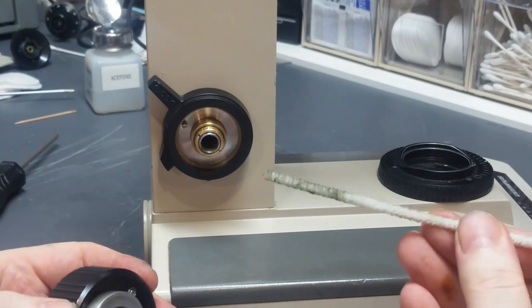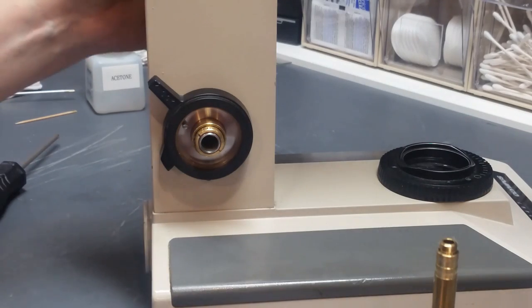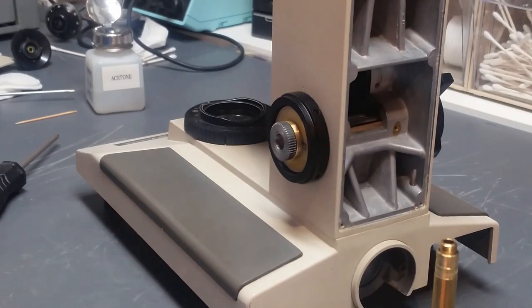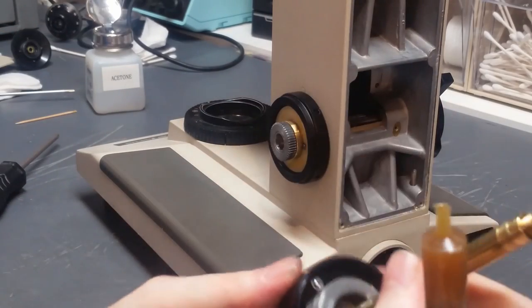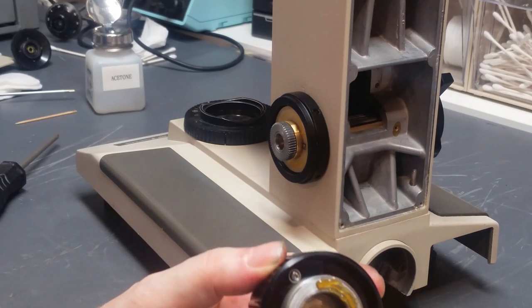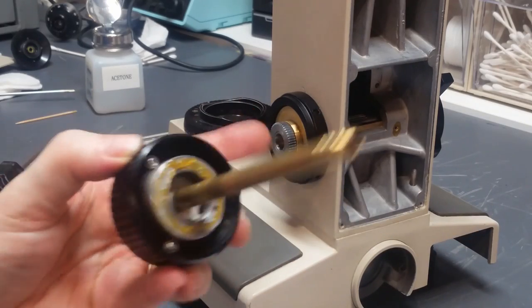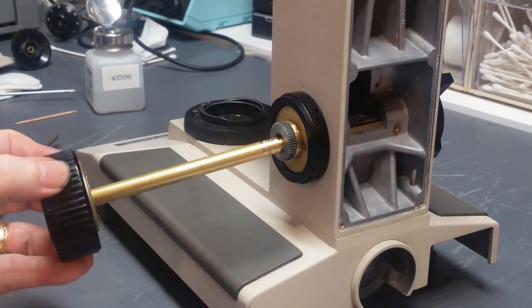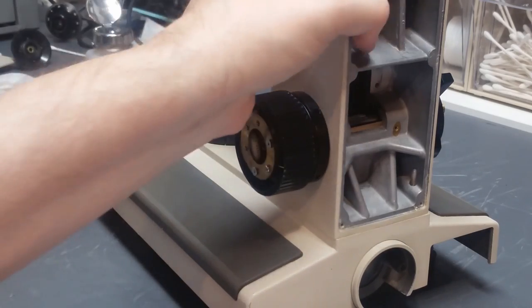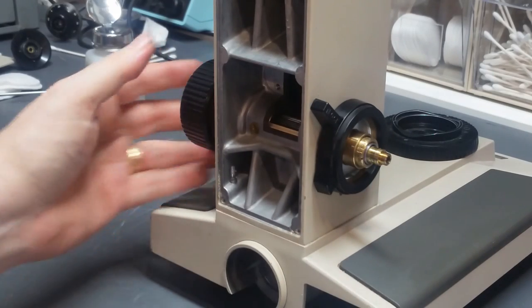Oh yeah, that was definitely worth doing. Okay, now what we do is we turn around here. I take this surface here, apply plastilube brake grease all along the bearing surface, and that will ride on top of that nylon thrust washer in there. And next thing I do is I just put this in. Let that seat, and then when I do that, as you can see, it comes out the side here.